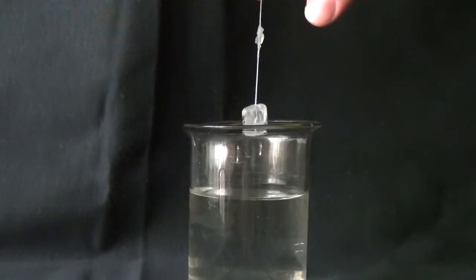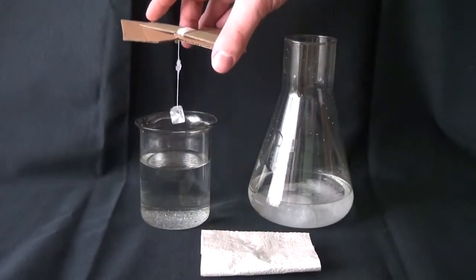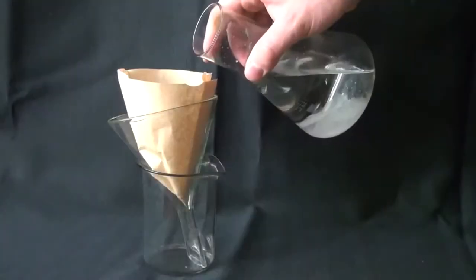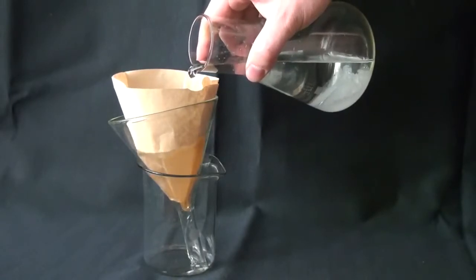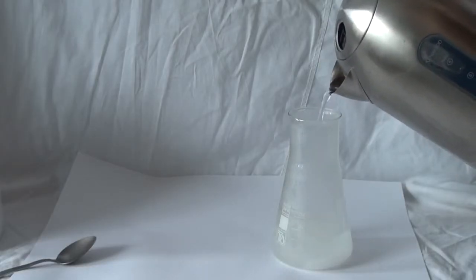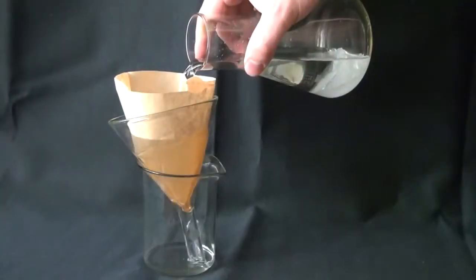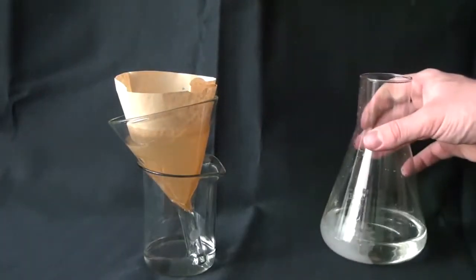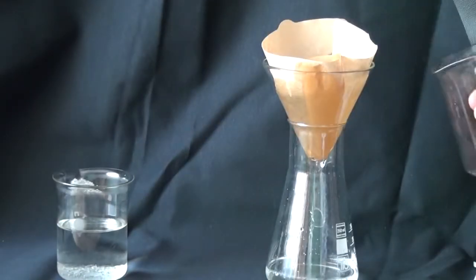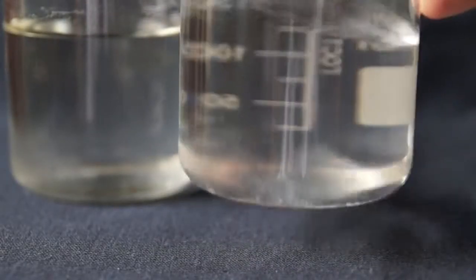And one more thing to mention. During the process of crystal growing, liquid from the cup will gradually evaporate and, therefore, the crystal grows. But that's also a problem. During the evaporation of liquid, it comes to a point when there won't be enough solution in the cup anymore, and the further growth of the crystal will be impossible. To solve this, once a month or once every two weeks, it is necessary to add a saturated solution into the beaker. The saturated solution must be prepared the same way as before. However, you should not add a warm solution — the saturated solution should be the same temperature as the growing crystal. Also, once a month or once every two weeks, I recommend filtering the solution to maintain its clearness. Over time, some specks or other debris might occur in the solution, which can damage the crystal.